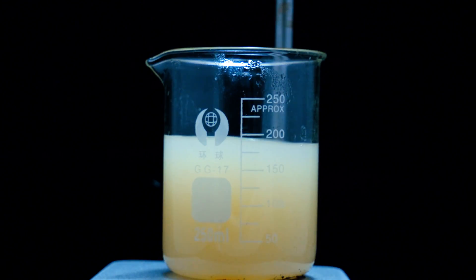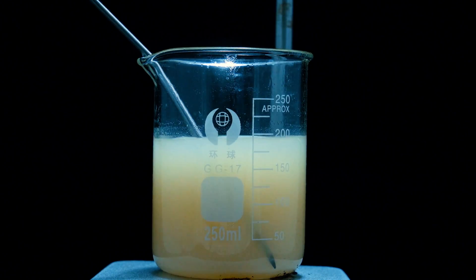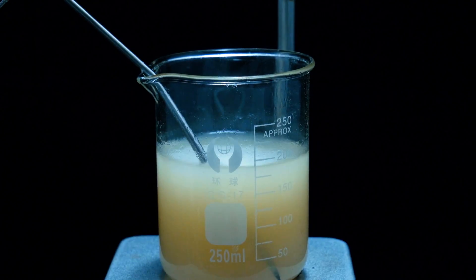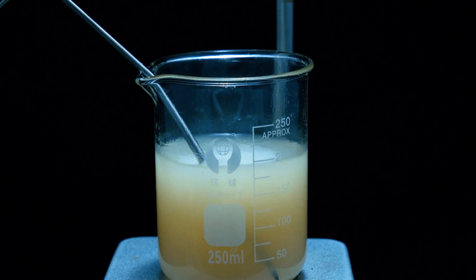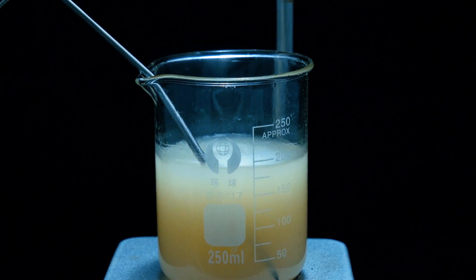Now we have a mixture of minerals and lactose and we want to separate them. Minerals are not soluble in hot ethanol whereas lactose is. By boiling the water and then adding ethanol, we are able to dissolve lactose while minerals remain undissolved. That's why we are able to separate them with simple filtration.